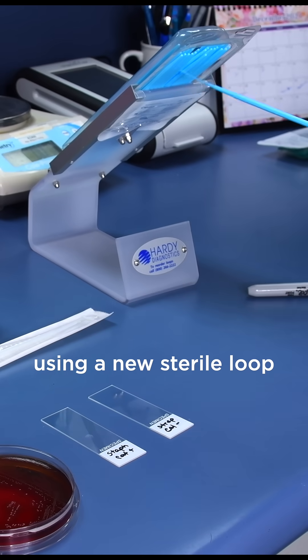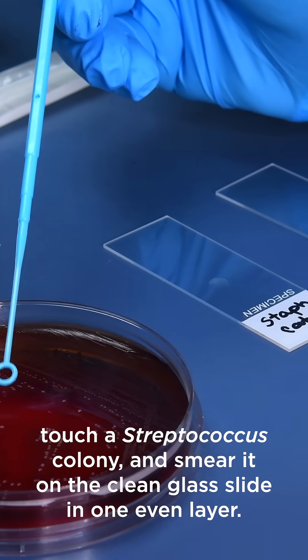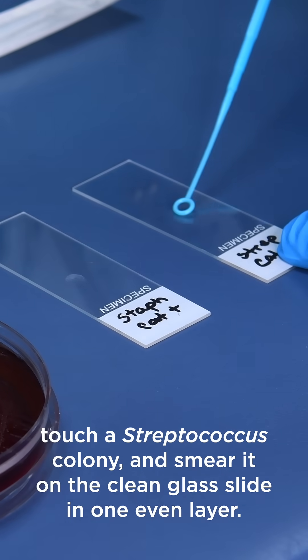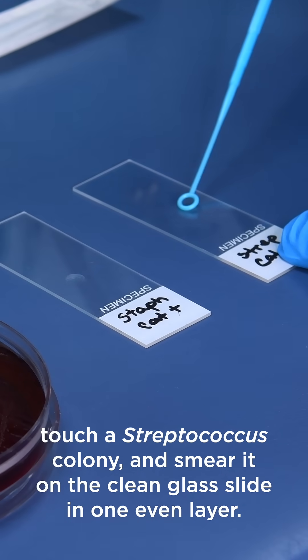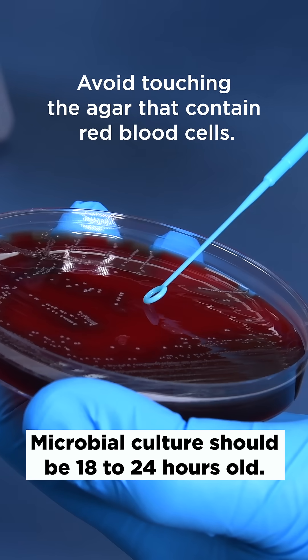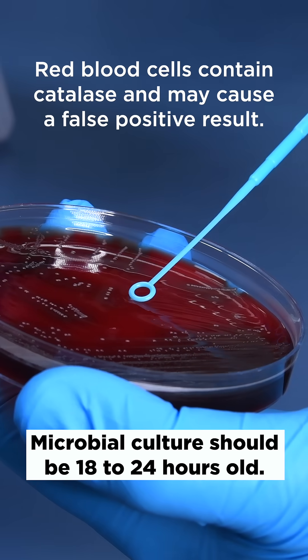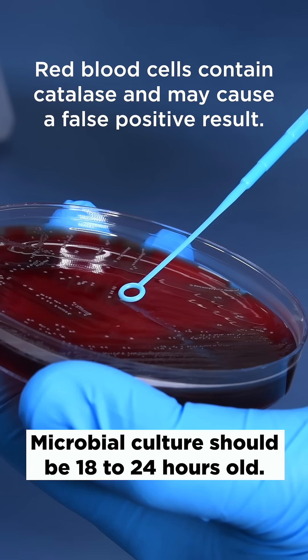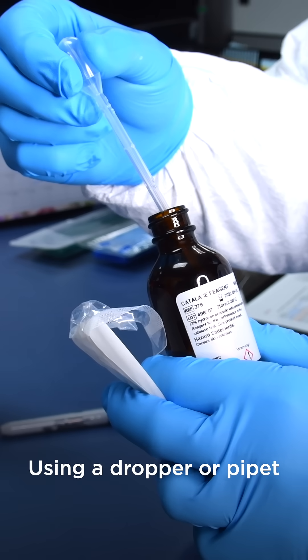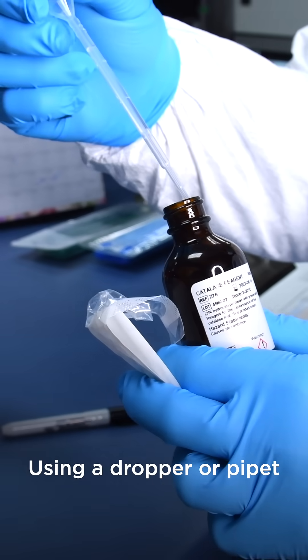Using a new sterile loop, touch a streptococcus colony and smear it on the clean glass slide in one even layer. Avoid touching the agar that contains red blood cells, as red blood cells contain catalase and may cause a false positive result.